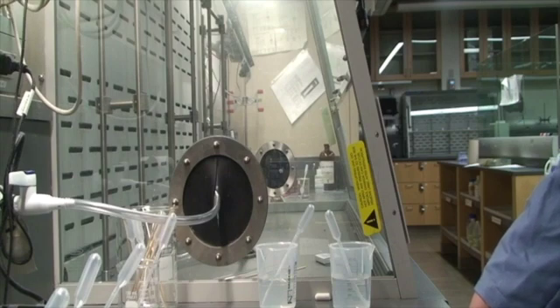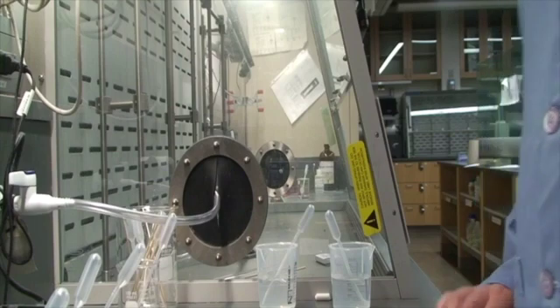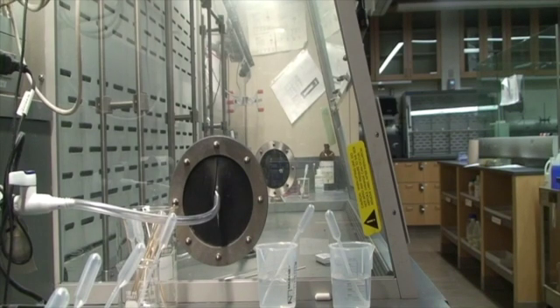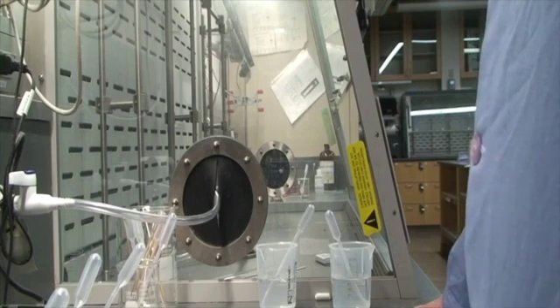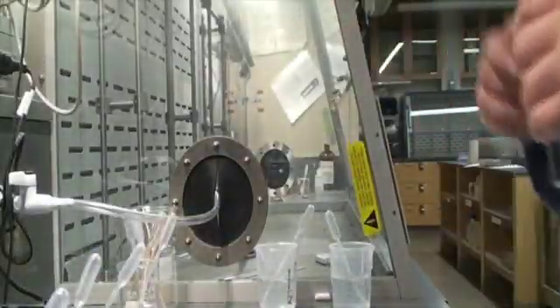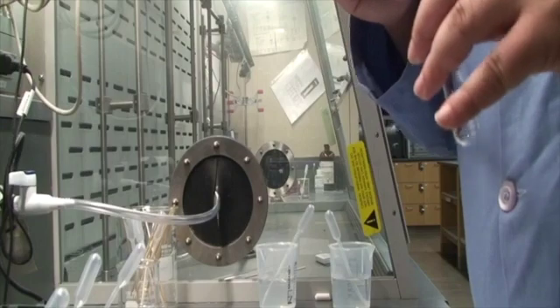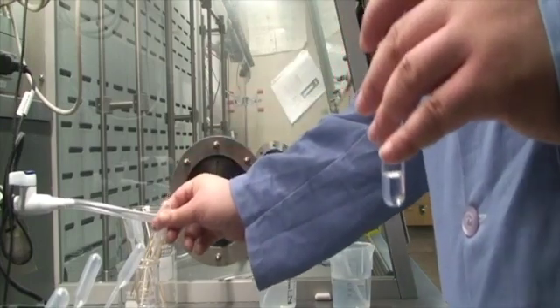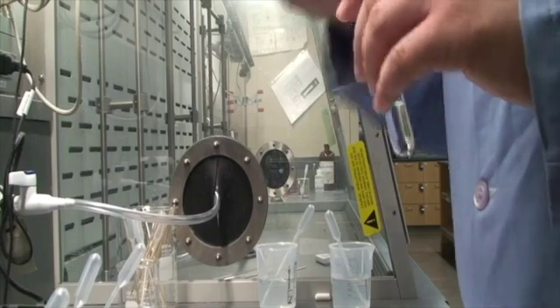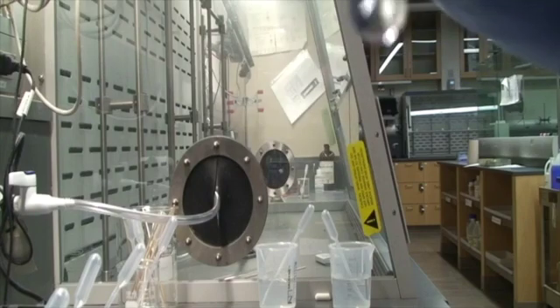I'm going to add sodium sulfate, I'm going to add sodium hydroxide, and then I'm going to do a flame test. We'll do the flame test last. It's a little bit of a separate video. But let's try the other ones first. So 2 test tubes here. Here's my unknown. We'll put 2 milliliters of my unknown into 1 test tube. See, the unknown is clear. Clear solution.